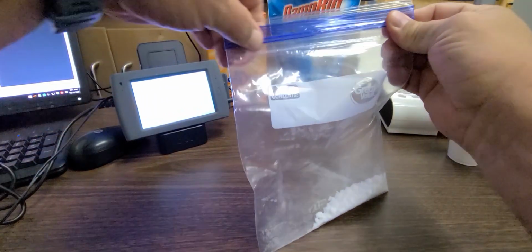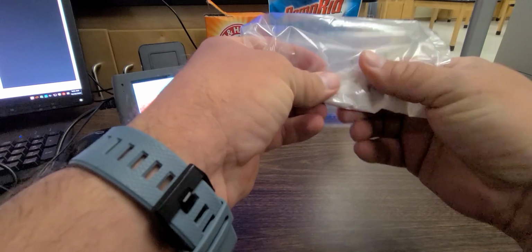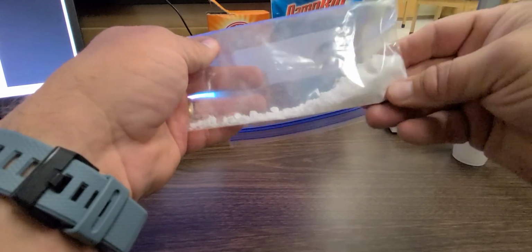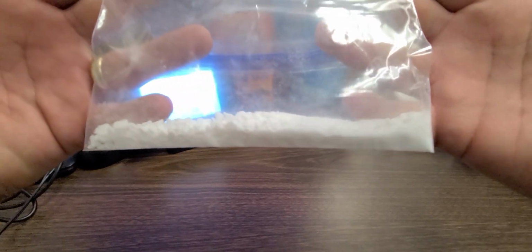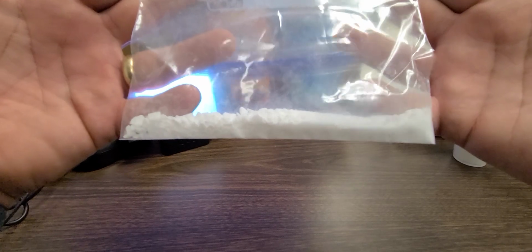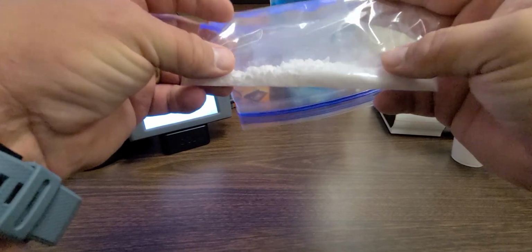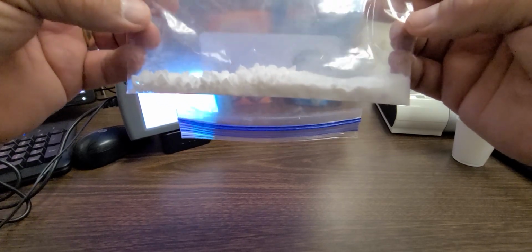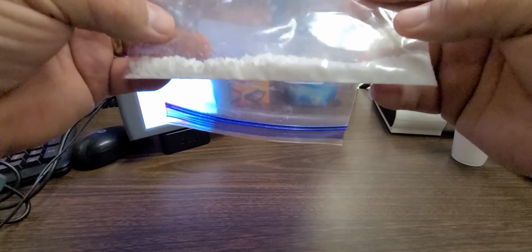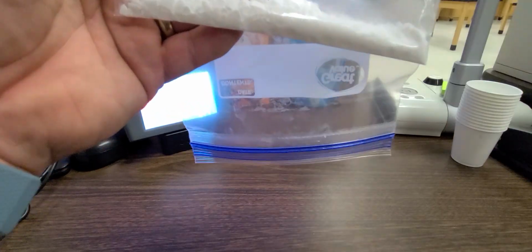I'm going to go ahead and zip it closed and kind of mix it up a little bit. And so this is where you're going to make those observations now that the two substances are mixed. Do you see any evidence whatsoever of any chemical changes that are occurring when we mix these two chemicals? So you're going to be writing down whether or not you think that I have created a new substance in the bag or whether or not I've just created a physical mixture of these substances in the bag. So make sure that you pause the video and write down those observations as we go.